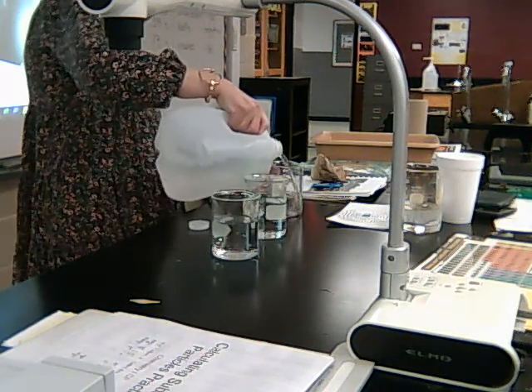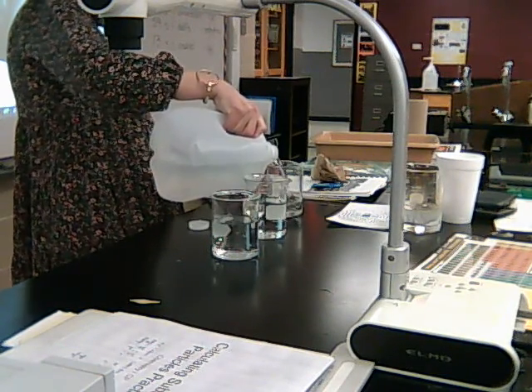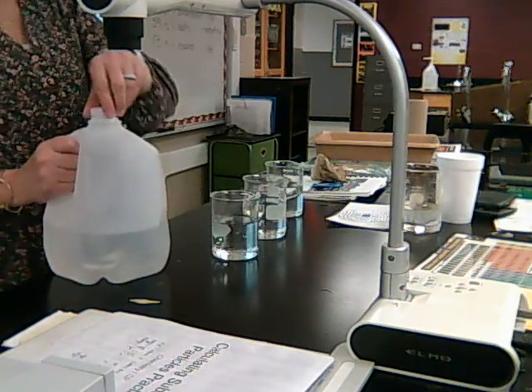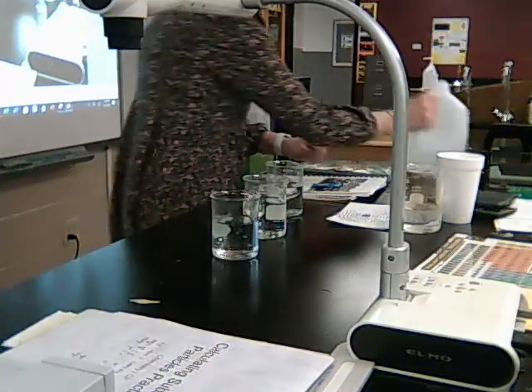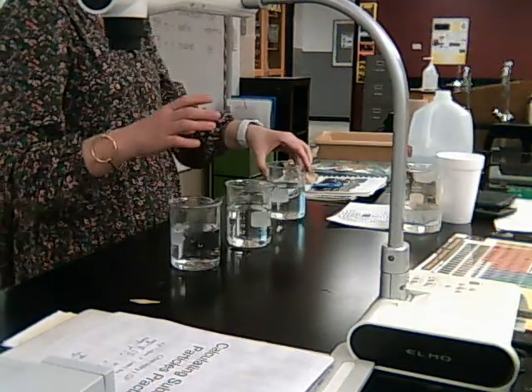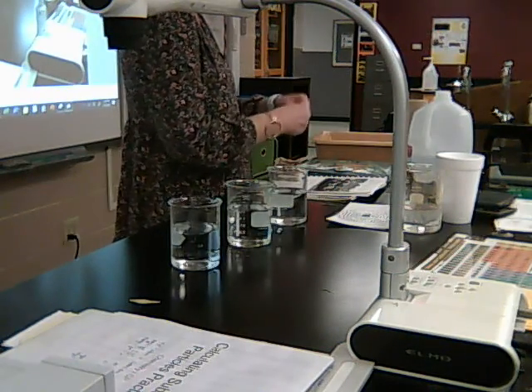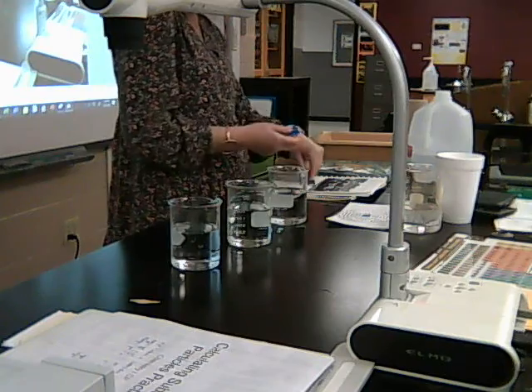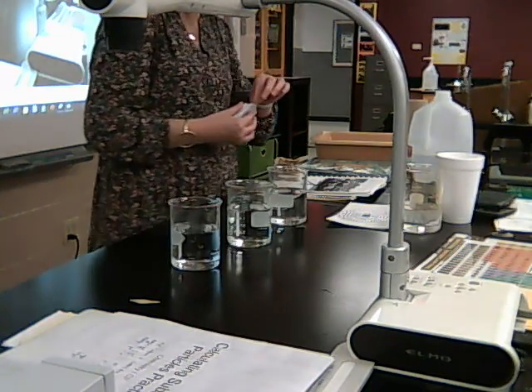I'm not going to change the temperature. I'm going to use the same temperature in all of them. I'm not going to change the brand of Alka-Seltzer. I'm going to use the same brand every time, the name brand Alka-Seltzer, because I don't want that to be a factor affecting my results.